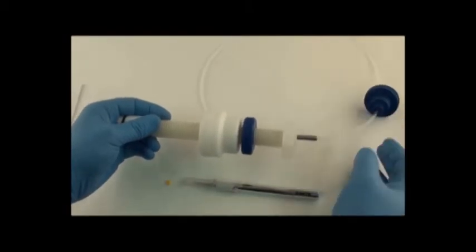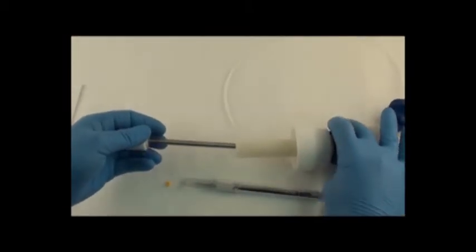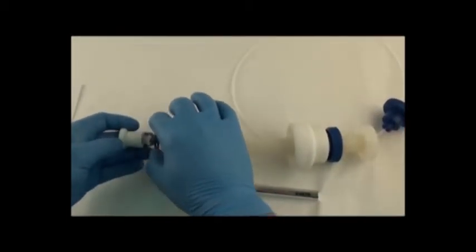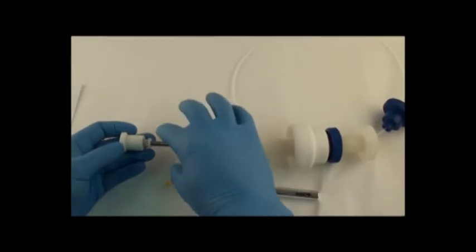Just slide that back and then we'll be able to remove this threaded rod, this collar, and the o-ring, this is a TFE propylene o-ring.